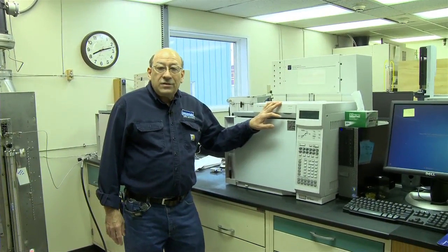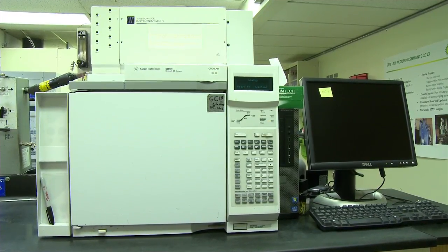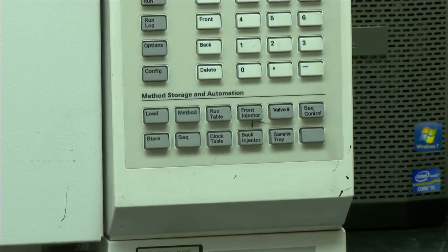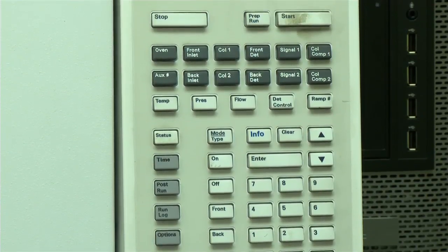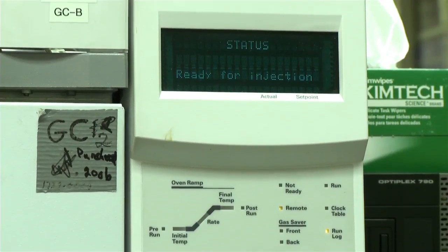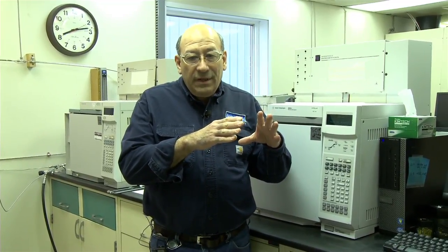This is our gas chromatograph, and we use this to run gas analysis on all our gas samples. Essentially, we inject a gas sample into the chromatograph. It goes through a heated column in an oven and generates data after about 40 minutes. It takes 30 to 40 minutes roughly to run one gas sample. And essentially all it does is it heats up the gas and puts it into a gas state where the molecular weight of the different constituents from methane all the way to C9, depending on the weight, come out at different times on the chromatogram.